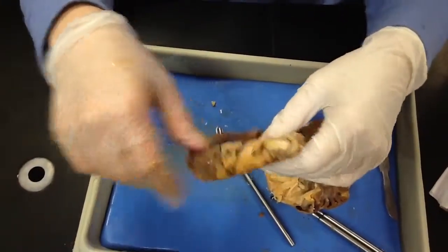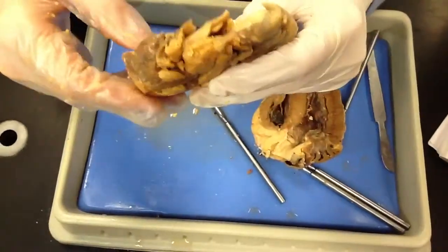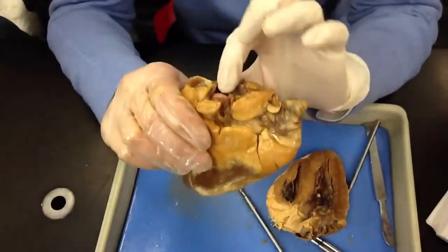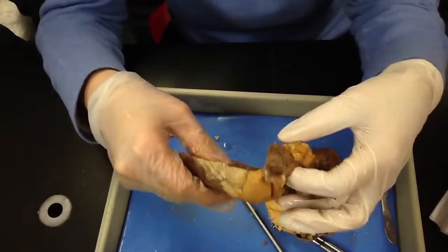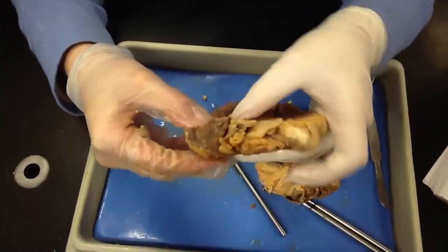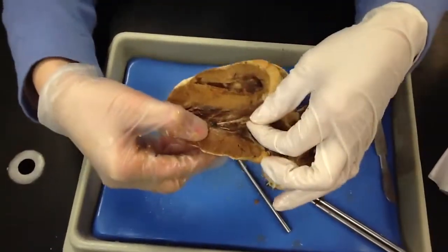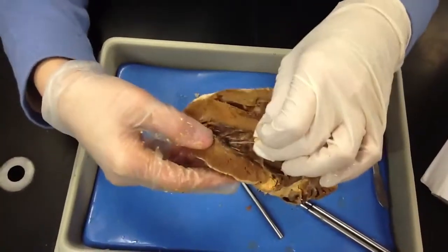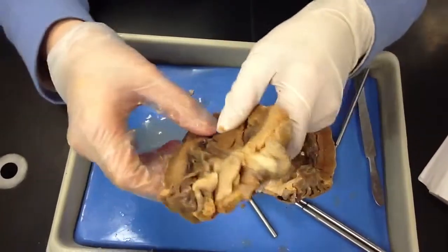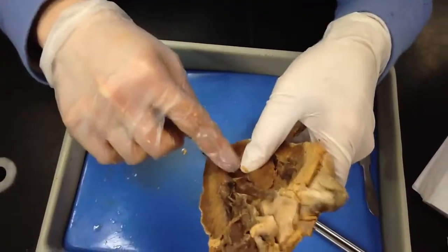There was something. So that should be where your aorta is. This right here is your left. So this should be your pulmonary vein. Okay, the pulmonary vein is going to go into the left what? Left atrium. It's going to pass through which valve? Bicuspid. AV though. It's bicuspid, right? So the mitral. Bicuspid, mitral. Yeah. But AV on the other side is the tricuspid. And then it's going to flow into what? Left ventricle.